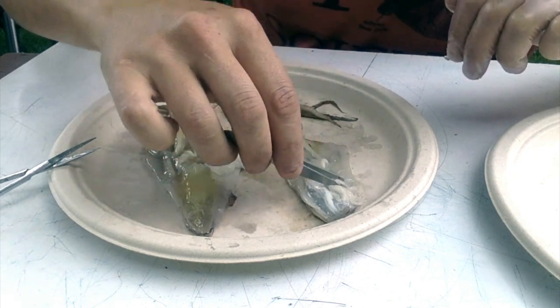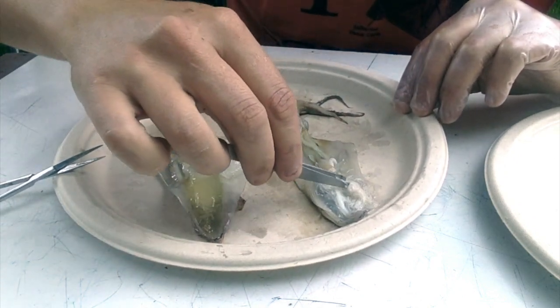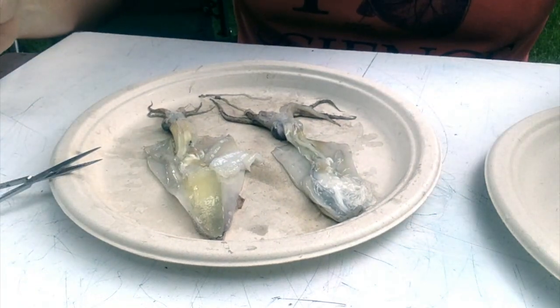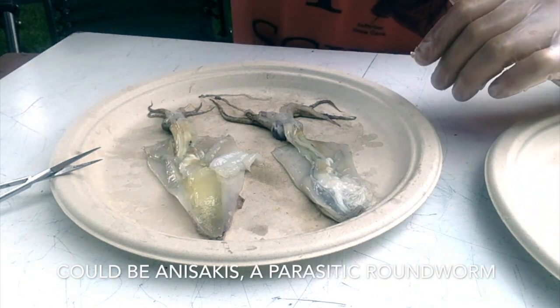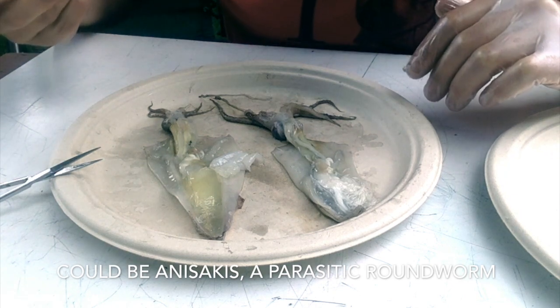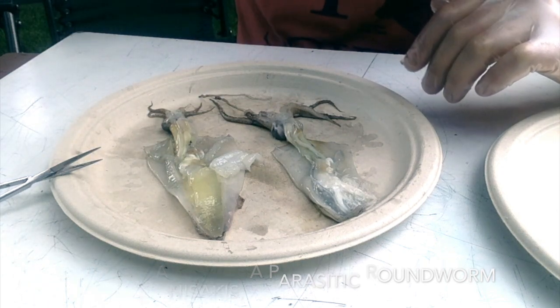This squid has a lot of extra stuff in it that I don't remember seeing in other dissections before. So there's all these white little stringy things. I don't know if that was the contents of one of the organs or potentially some kind of parasite. I really don't know. I hate to speculate, but it's very interesting and pretty strange. Might be something to look at under a microscope to see if those are actual separate worms. Maybe I'll put a few into the water and see what they look like in there.